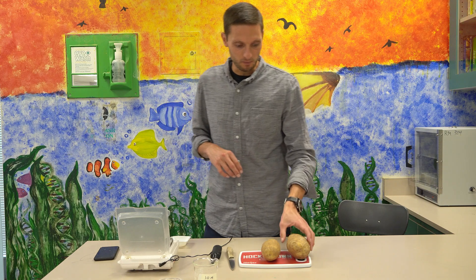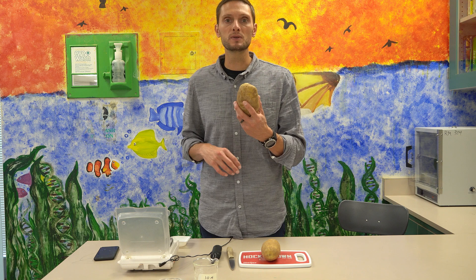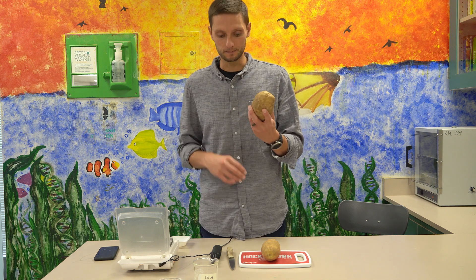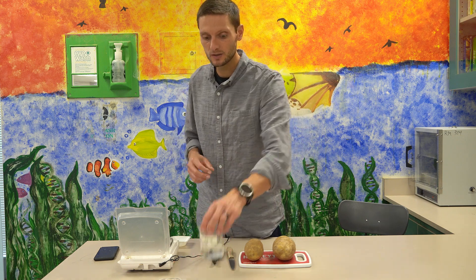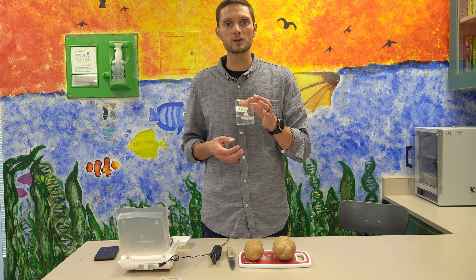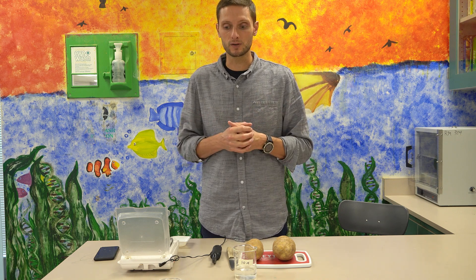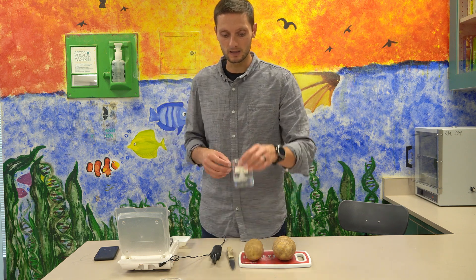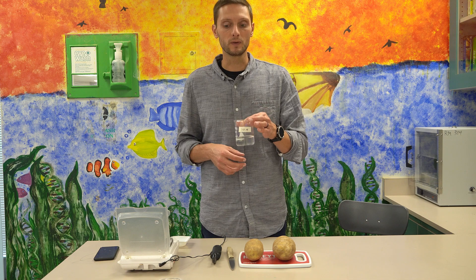To get started, I'm going to peel the potato and cut six different cubes, each 2 centimeters by 2 centimeters. I'll place each cube into one of the beakers submerged in solutions of 1.0, 0.8, 0.6, 0.4, 0.2, and 0 molar saline. The saline solutions were made by dissolving salt in distilled water, heating and mixing them until the salt was fully dissolved.